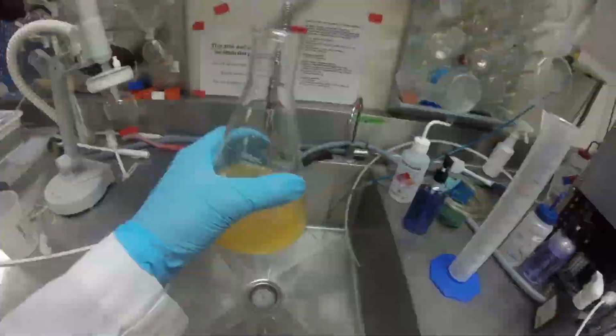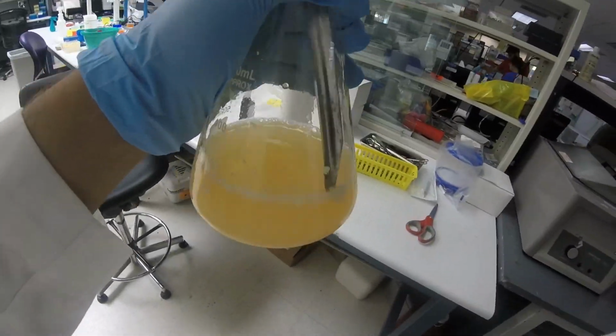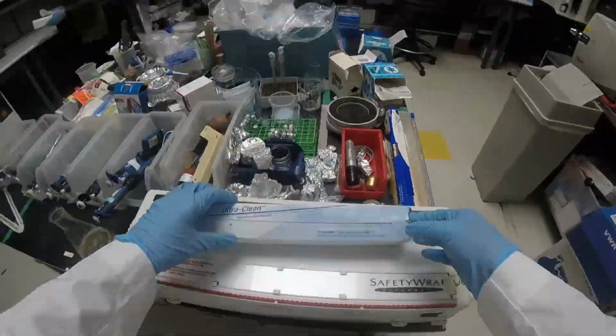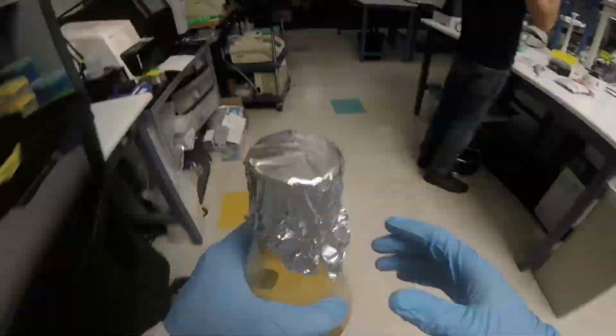So I wanted to see, can I recreate this plot? Can I basically take some media, start culturing it, and then sample the concentration of cells in my liquid media at different time points and see, is this really what I see in reality? Is it not just a model? And so I set out to do this at lab.